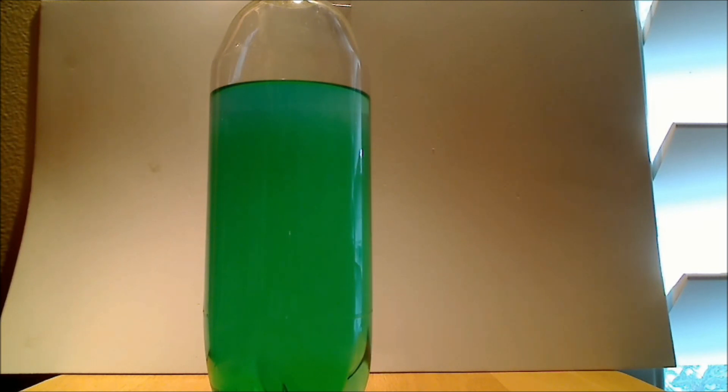So you can create such a mixture by, instead of mixing water and isopropyl alcohol, add a lot of salt to the water. Now, if you add just table salt, it's going to be kind of turbid because there's starch in the table salt. It's better to use some kind of salt that doesn't have any starch in it.